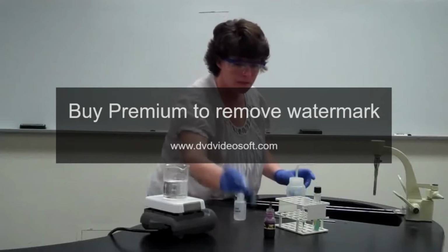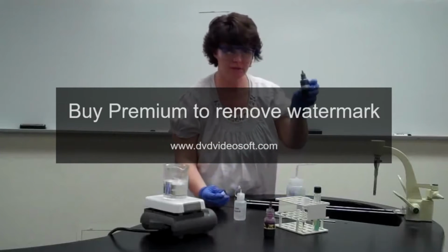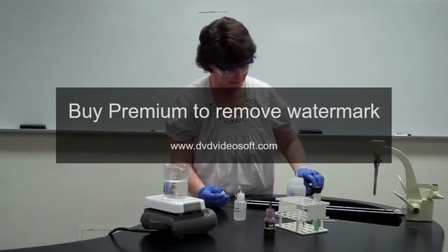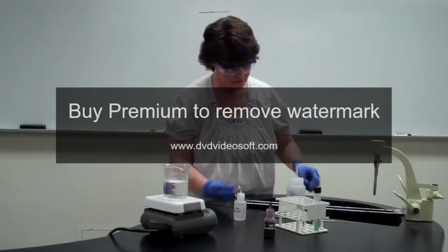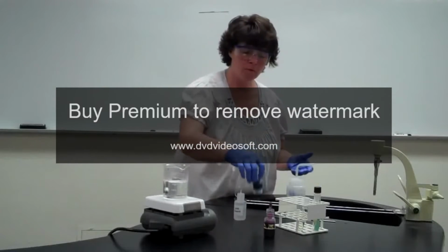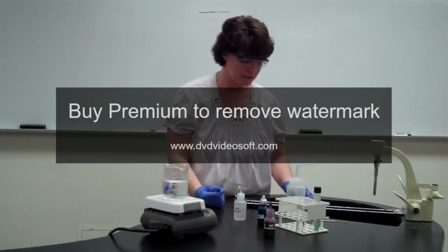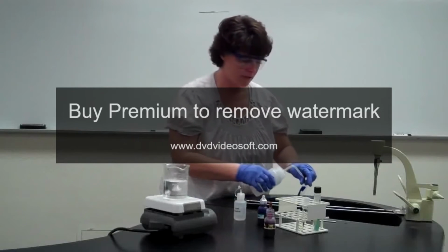Now we're going to use the secondary stain, which in this case is methylene blue, which you used in the first lab, your simple smears. Your lab manual says to leave that on for 1 minute. You can go 1, but even up to 2 minutes with your counterstain. So after that's set for its 2 minutes, we're going to rinse it off.